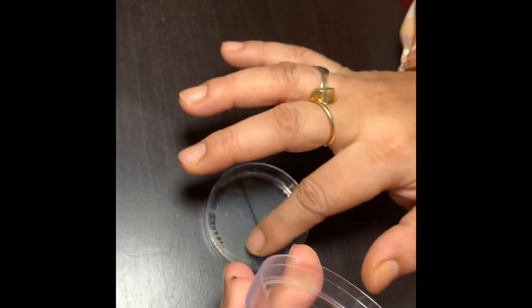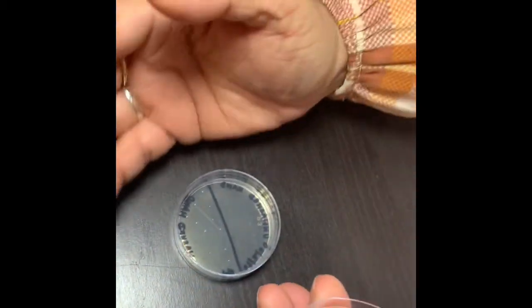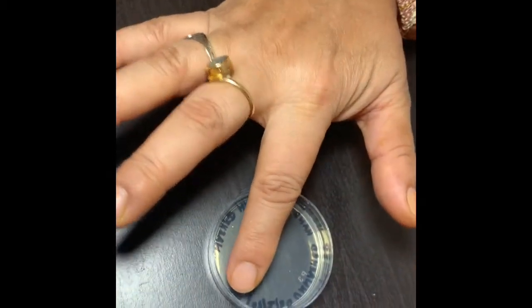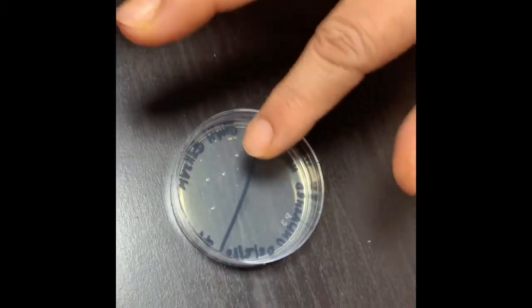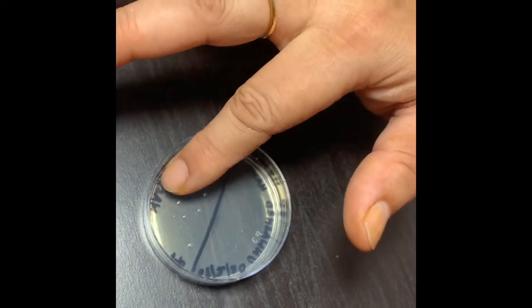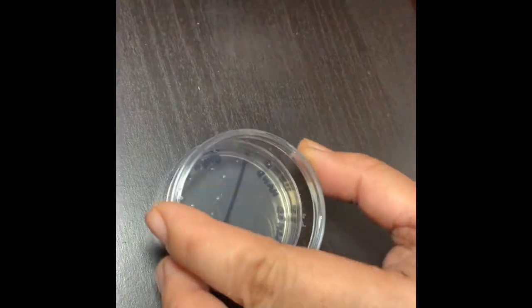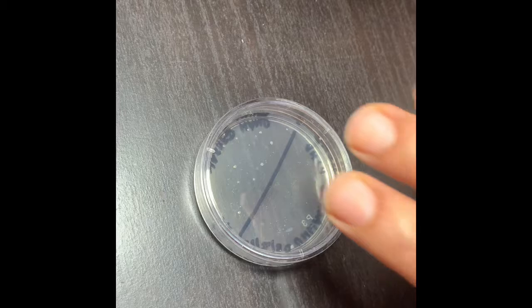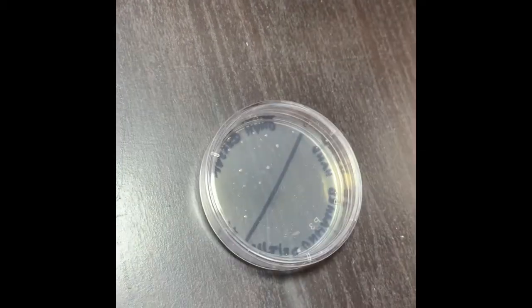Why we get interesting results and why students get frustrated with the results, I will discuss in the results video. It will incubate and we'll see the growth of microorganisms in the two halves of the agar plate.